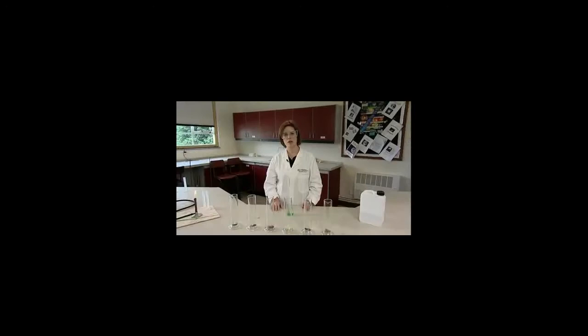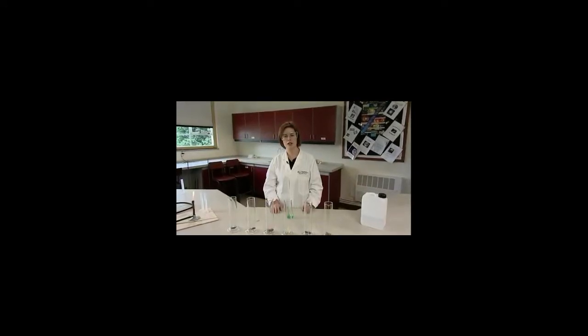This demonstration is a fun way of showing the effect of different catalysts on the rate of decomposition of hydrogen peroxide. Before moving on to the demonstration, it is important to establish for the students that hydrogen peroxide is indeed decomposing all the time, otherwise the students may confuse reactants with catalysts. One possible way of doing this is to show that the bottle of hydrogen peroxide is vented to allow oxygen to escape.